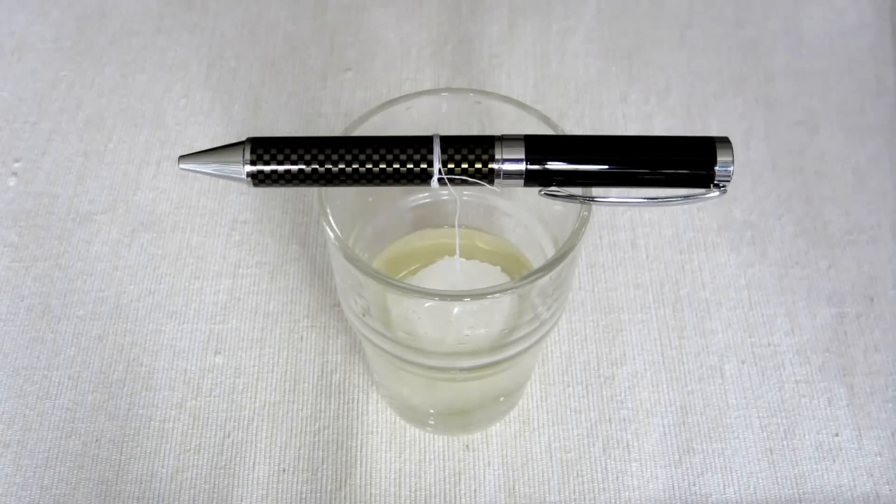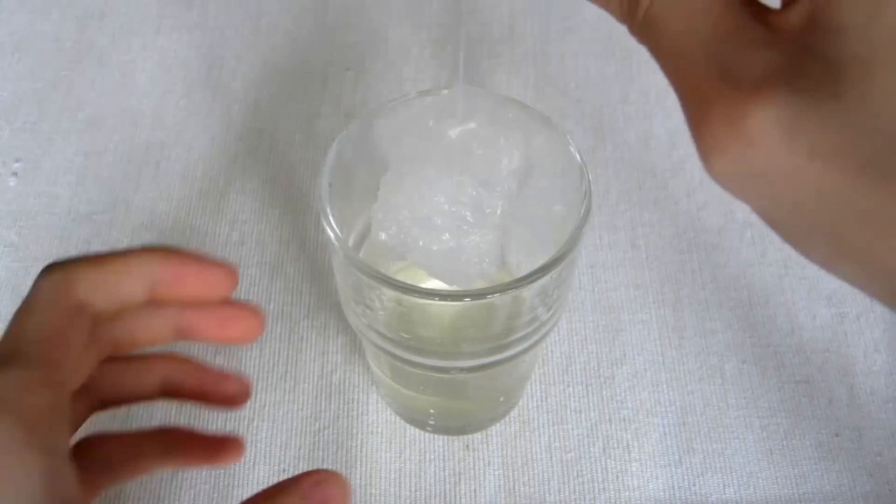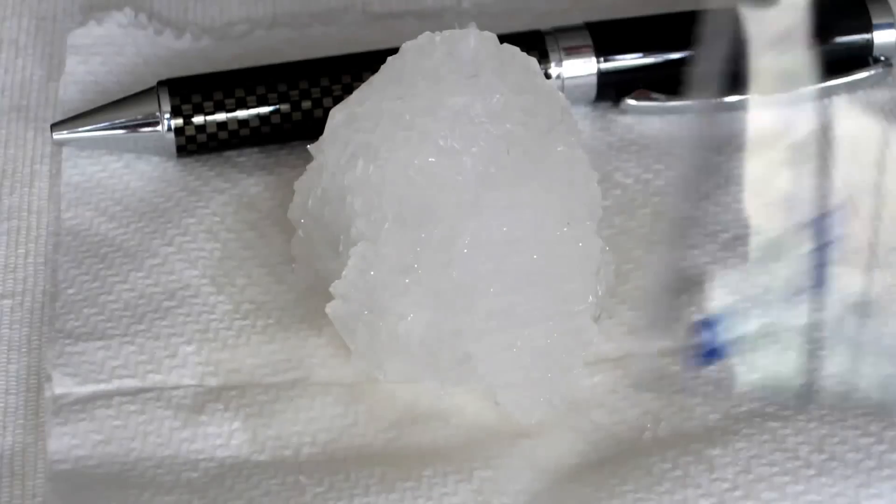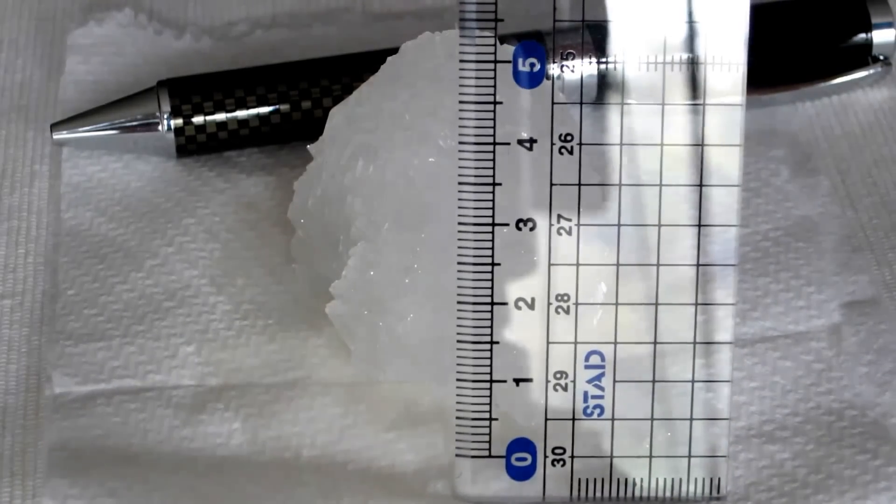After a few days, you can take it out of the jar and put it on the filter paper or multifold towel paper. The crystal is pretty large. That's good.